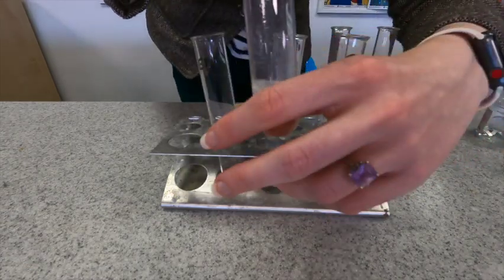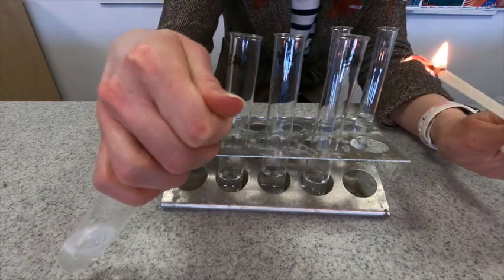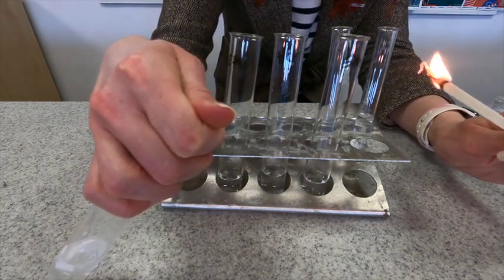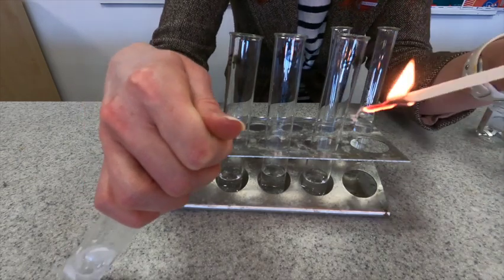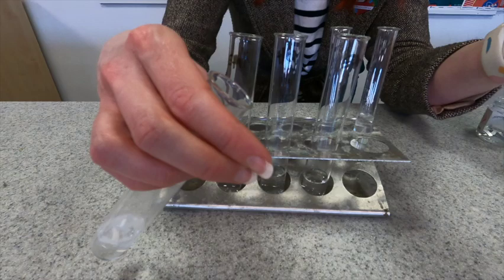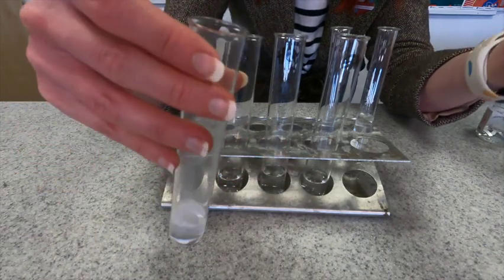As the reaction progresses I will be able to feel that the tube will get hot. So I'm going to try and trap as much hydrogen in here as possible and then do my squeaky pop test once it has built up a little bit. You can see there that we have definitely got hydrogen present in this reaction.